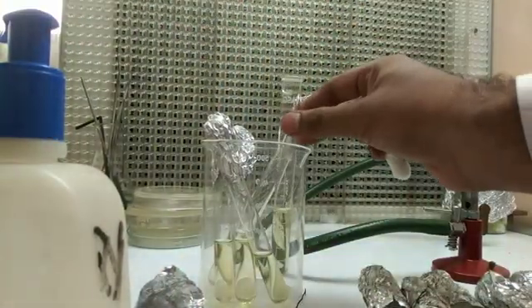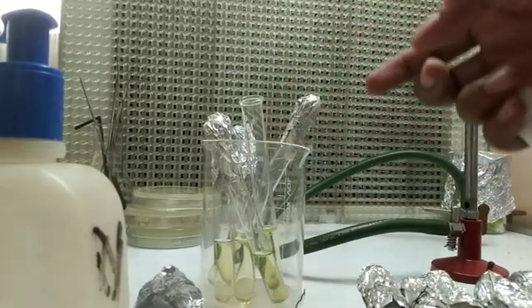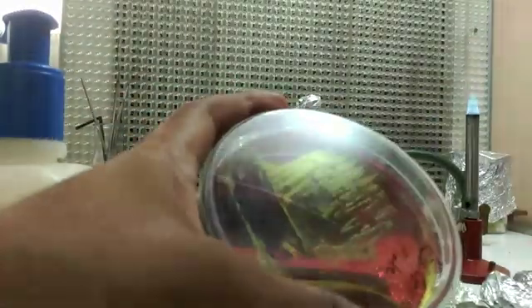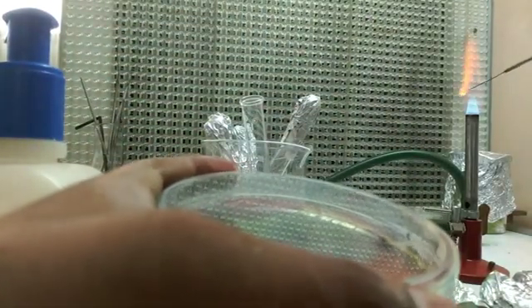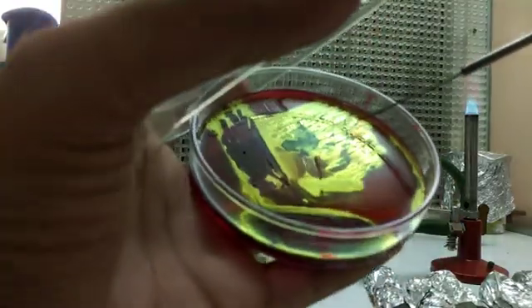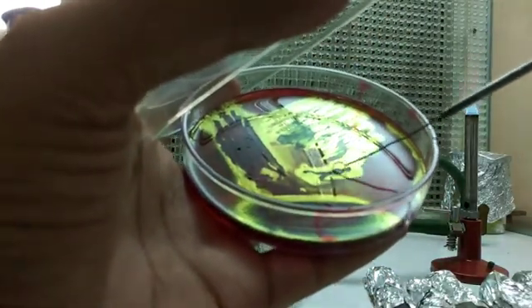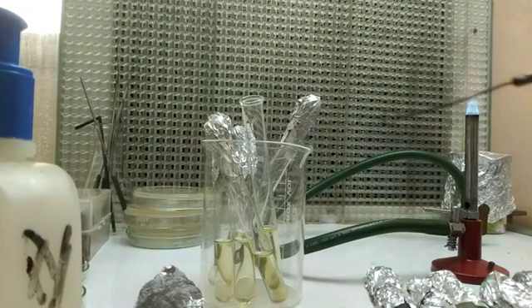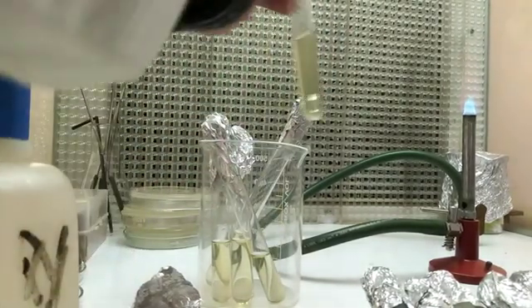Place the test tube in a sterile beaker. Take the bacterial culture — here I am using E. coli, you can see the green sheen on the plate. Sterilize the inoculation loop by heating it until it becomes red hot, then allow it to cool. Take the E. coli sample with the cooled inoculation loop so it is full of bacteria.